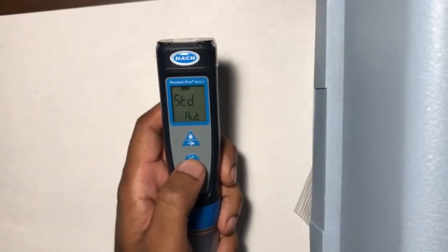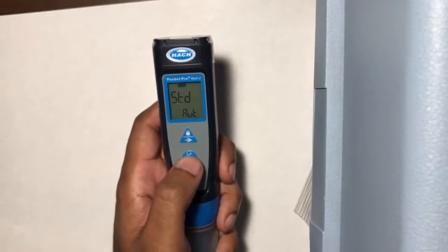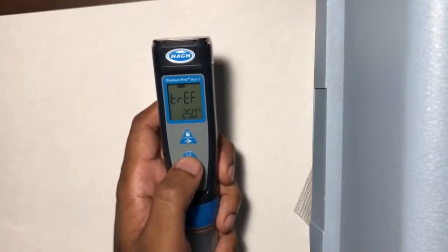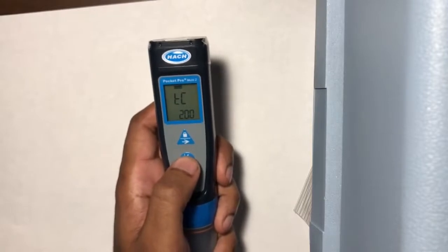Standard. This is the conductivity standard that you use to calibrate. This would be set to AUT. This means that the meter automatically detects the conductivity solution that you're using during calibration. For us, that's the 1413 microsiemens solution. TREF. This affects conductivity readings as well. We want this at 25 degrees Celsius. TC also affects how the meter reads conductivity. We want this at 2.00.